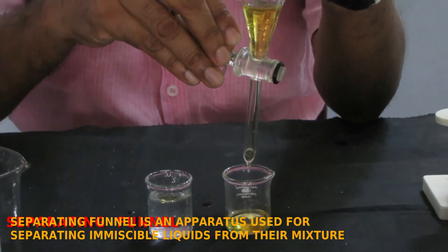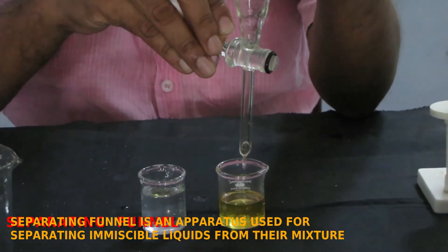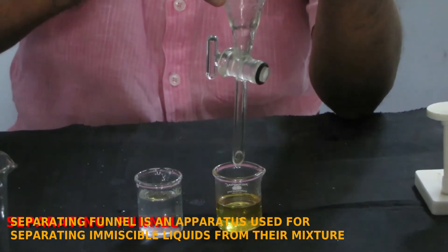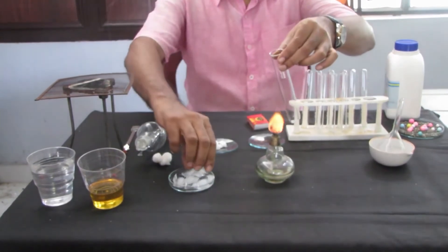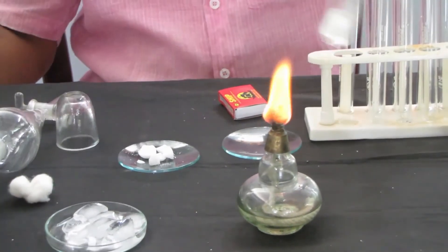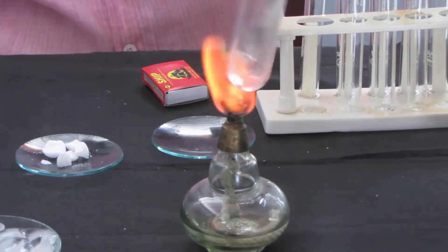We will use two immiscible liquids. Do you understand the two liquid items? Let's take a look at the solution. This is a solid item. Let's do solid convert into liquid.